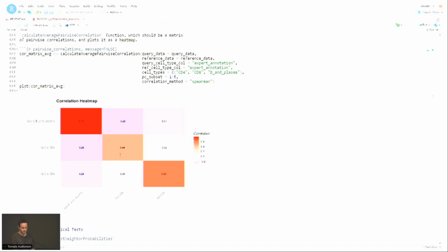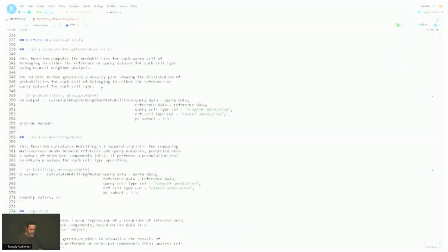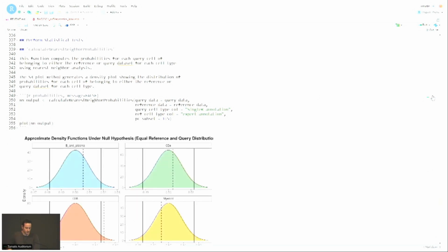So, all right. Yeah, there's a bunch of statistical tests that can be performed as well. I just put a few of them. If you go through the package documentation, there's way more. How am I doing on time? 7 minutes. Okay.